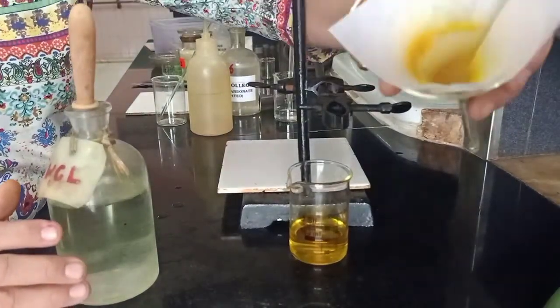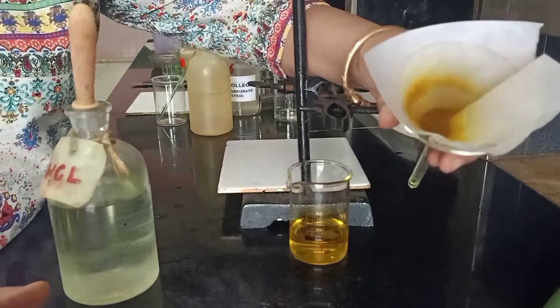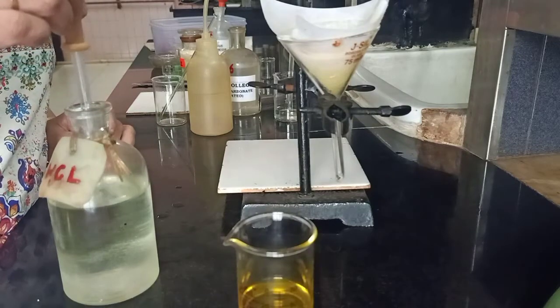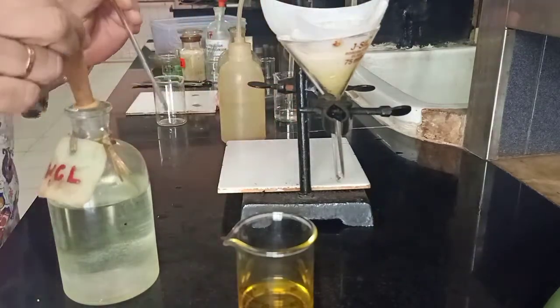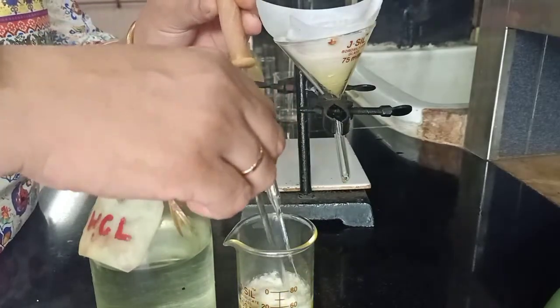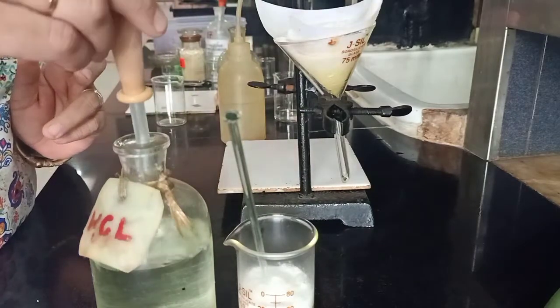As you can see, we have got the residue which is our component — identified as the water-insoluble base. We have washed it with bicarbonate and with water. We are now going to recover our acid by re-precipitation from the filtrate. The re-precipitation is going to be done using concentrated HCl. Add the acid slowly.